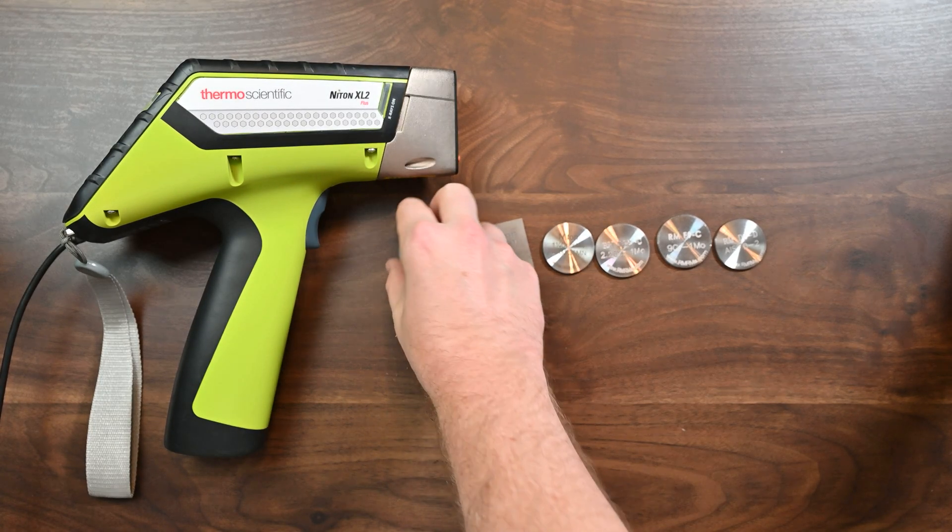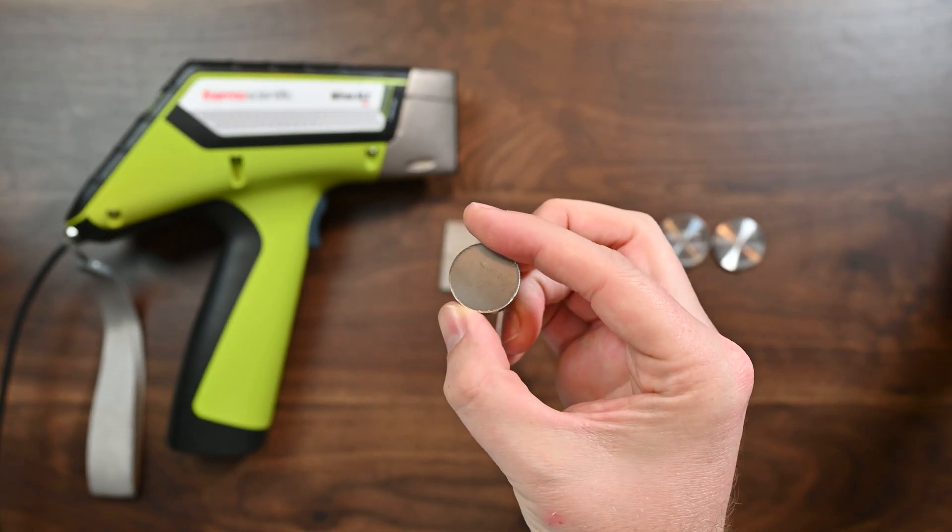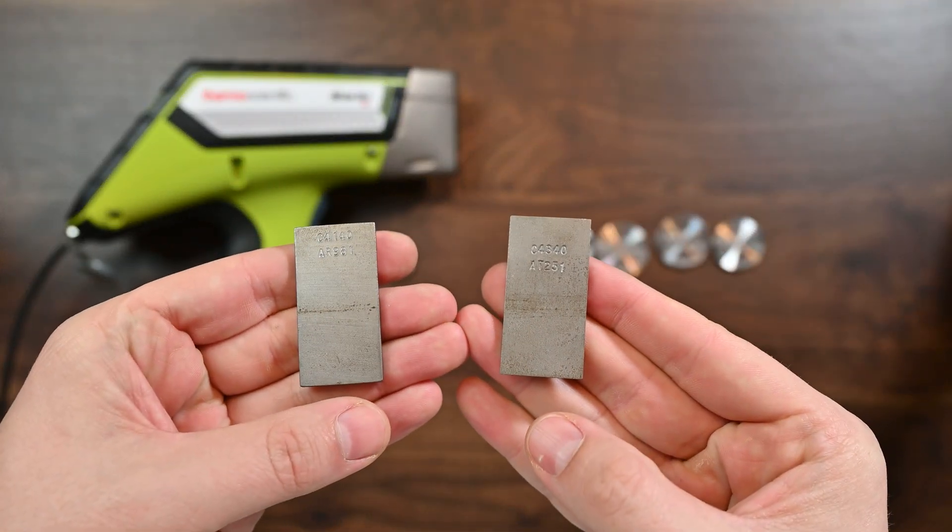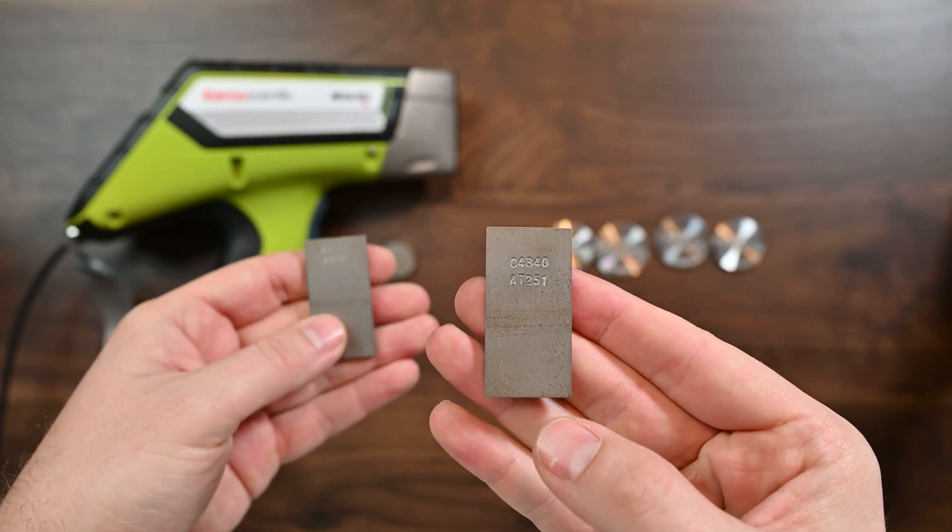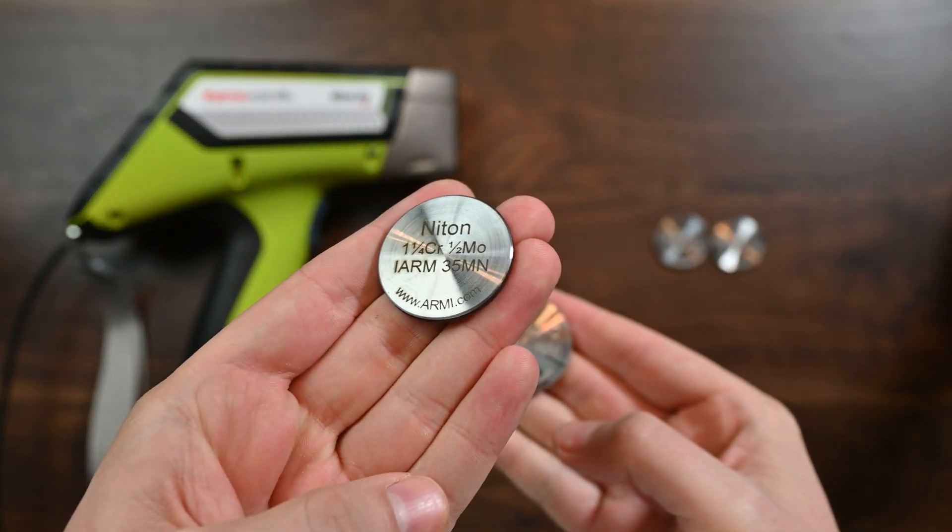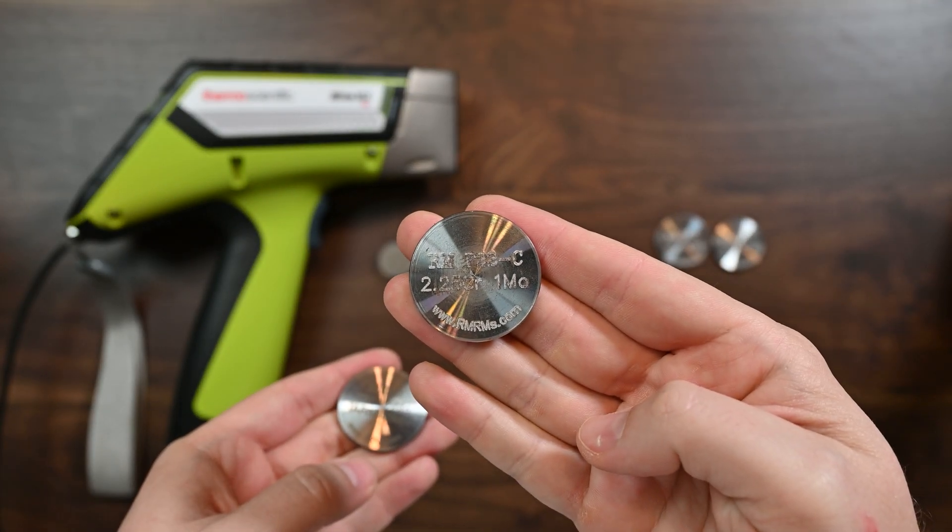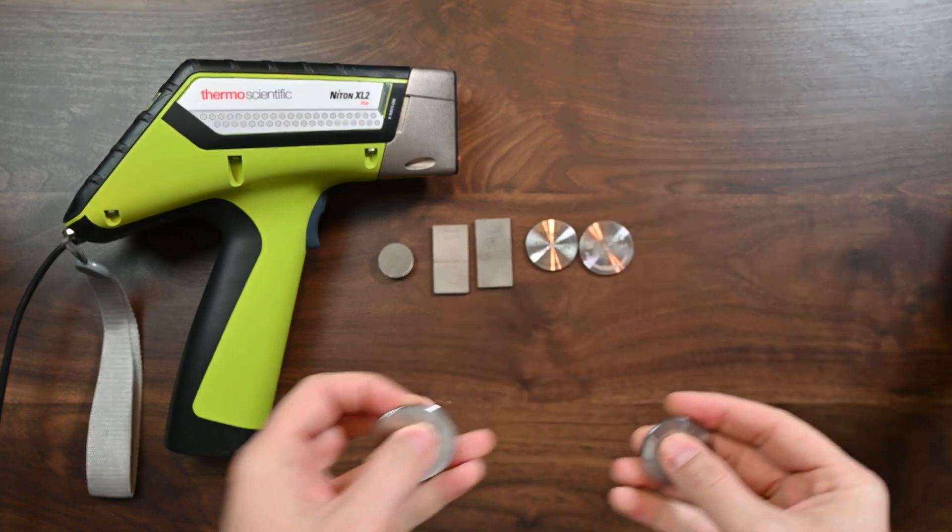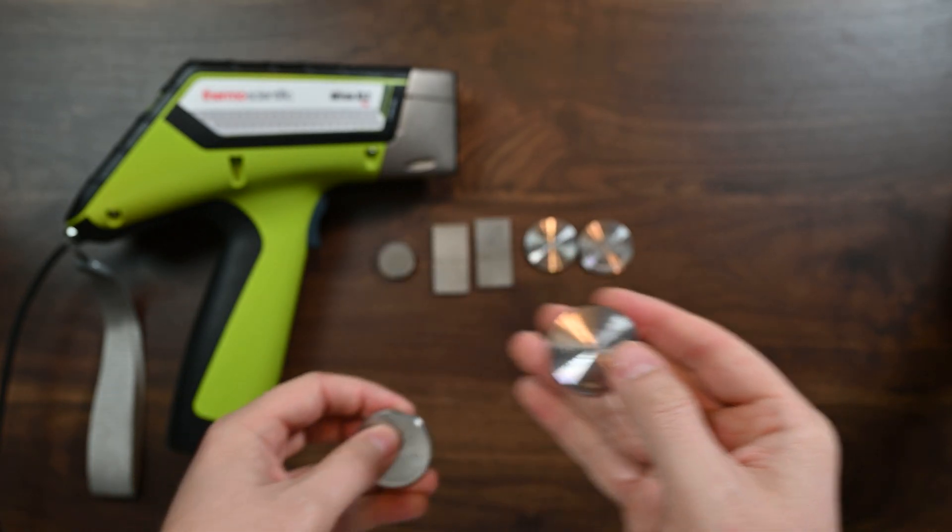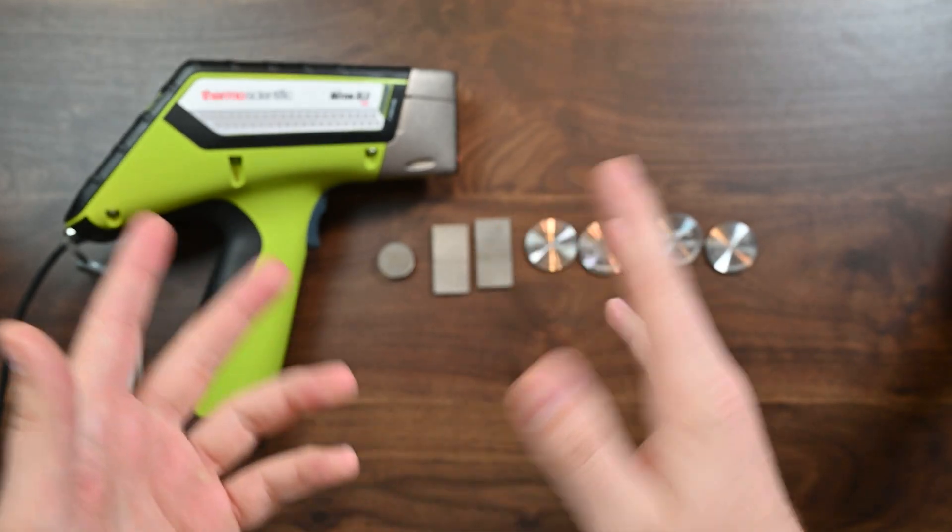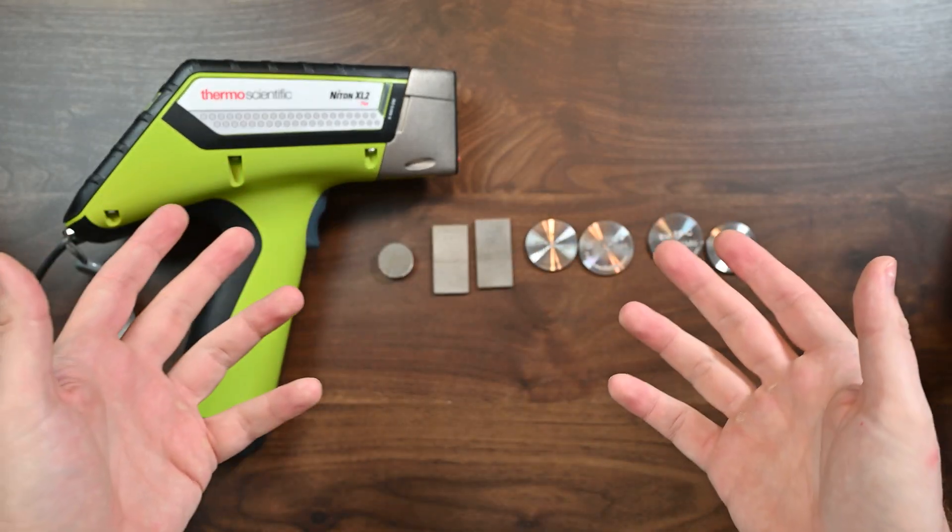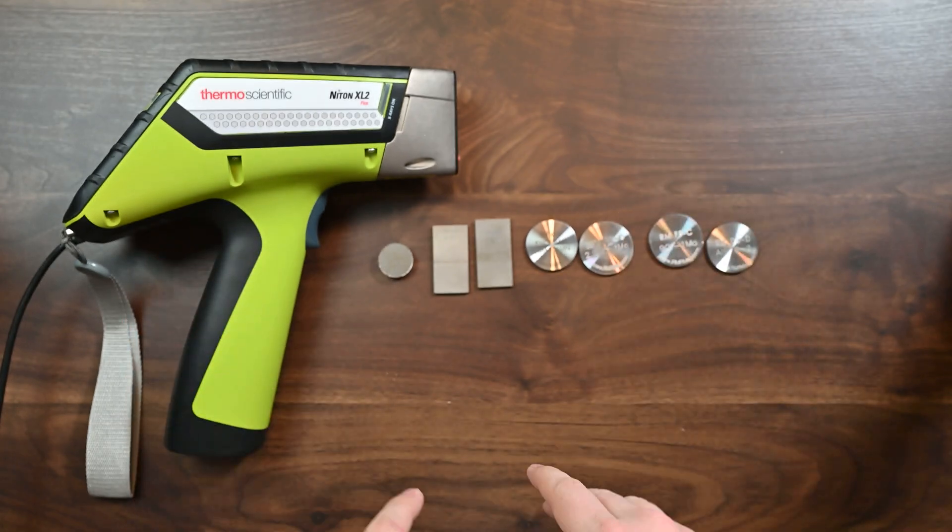I've arranged things down below. This is actually a powdered piece of metal - I don't have a certified chemistry, but it's just a steel piece with some higher copper levels. Then I've got two samples here: a 4140 and a 4340. We're going to go up in alloy content a little bit further with this one and a quarter chrome half moly and then to this two and a quarter chrome one moly. Then we're going to finish off with this nine chrome one moly and this D2, which actually goes over that 10 and a half percent chrome for the stainless steel limit. Everyone likes to use that limit, but to be honest, stainless steel is pretty much defined as it not corroding in the environment or surviving the environment, and that depends on a lot of factors.